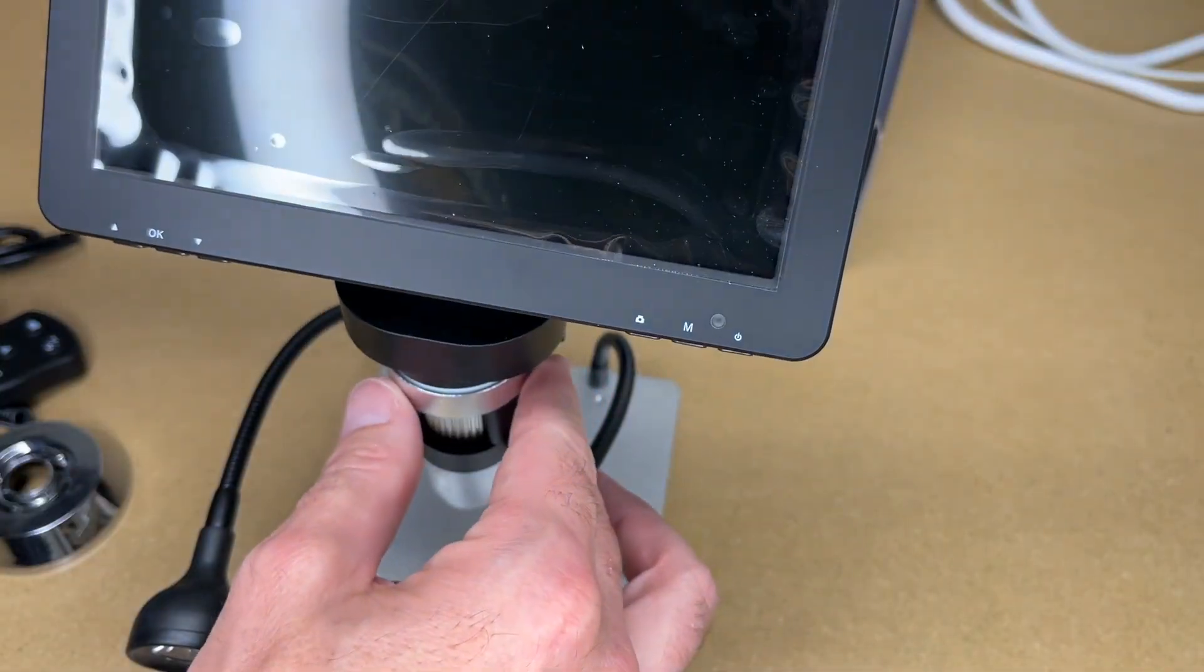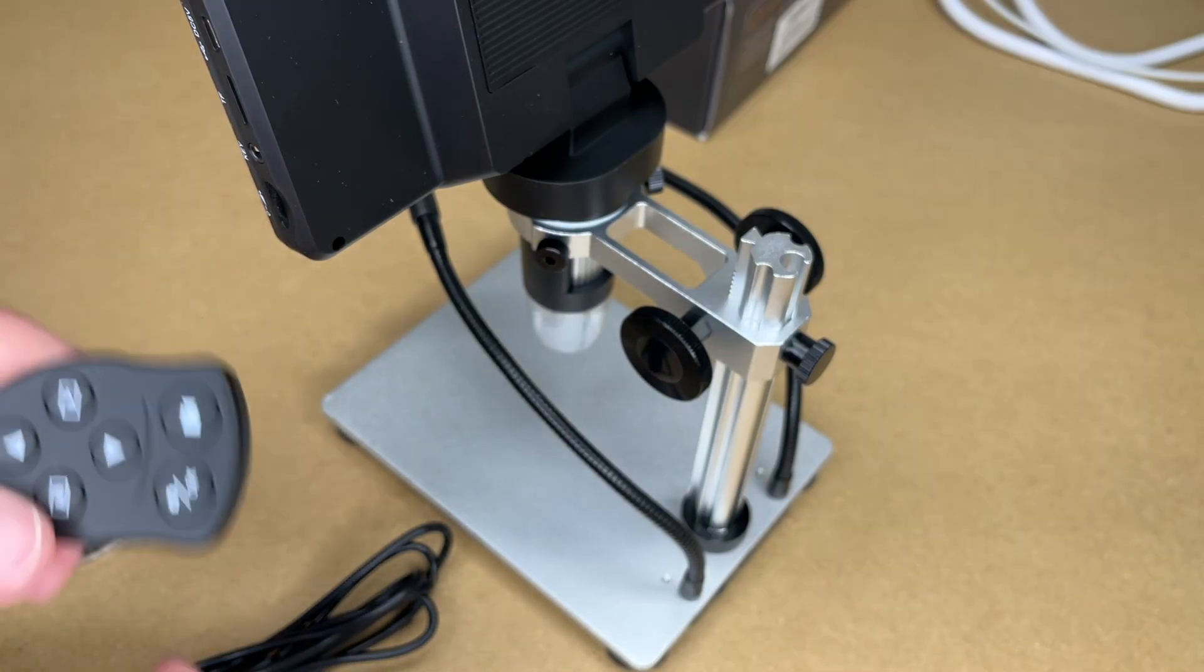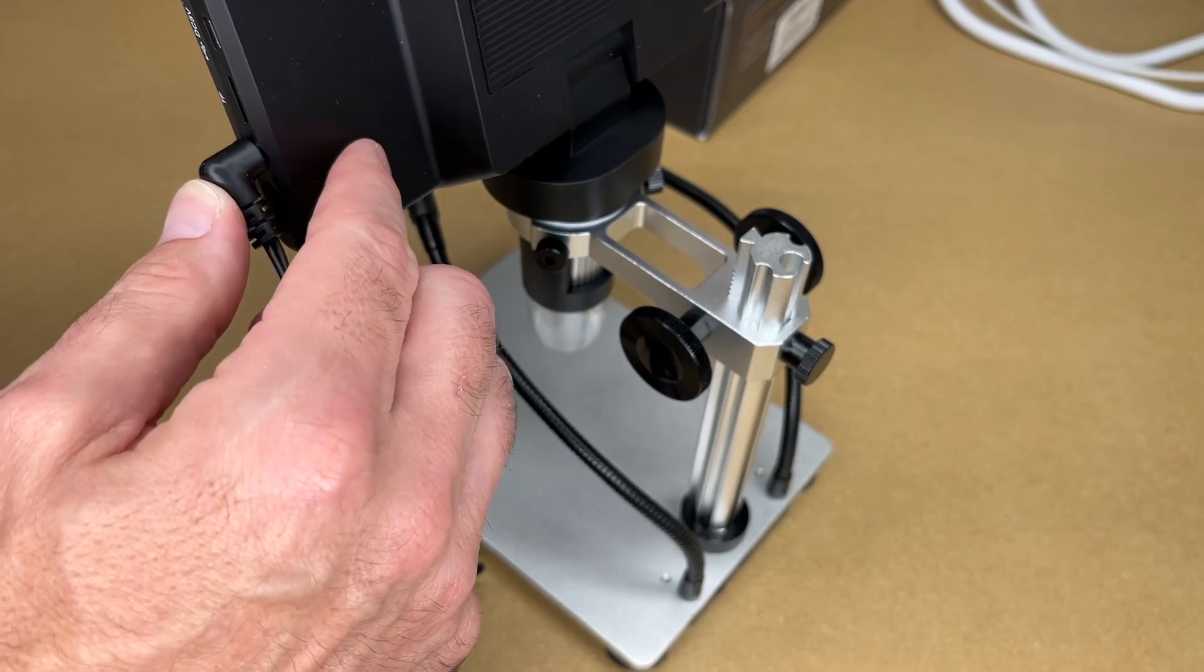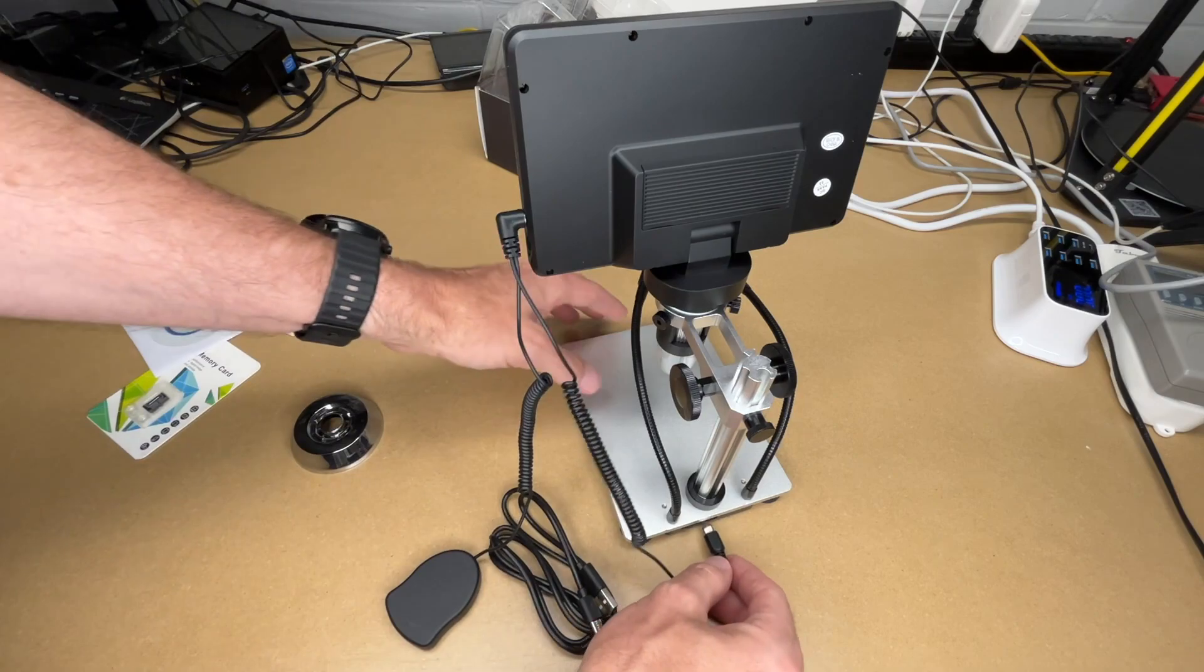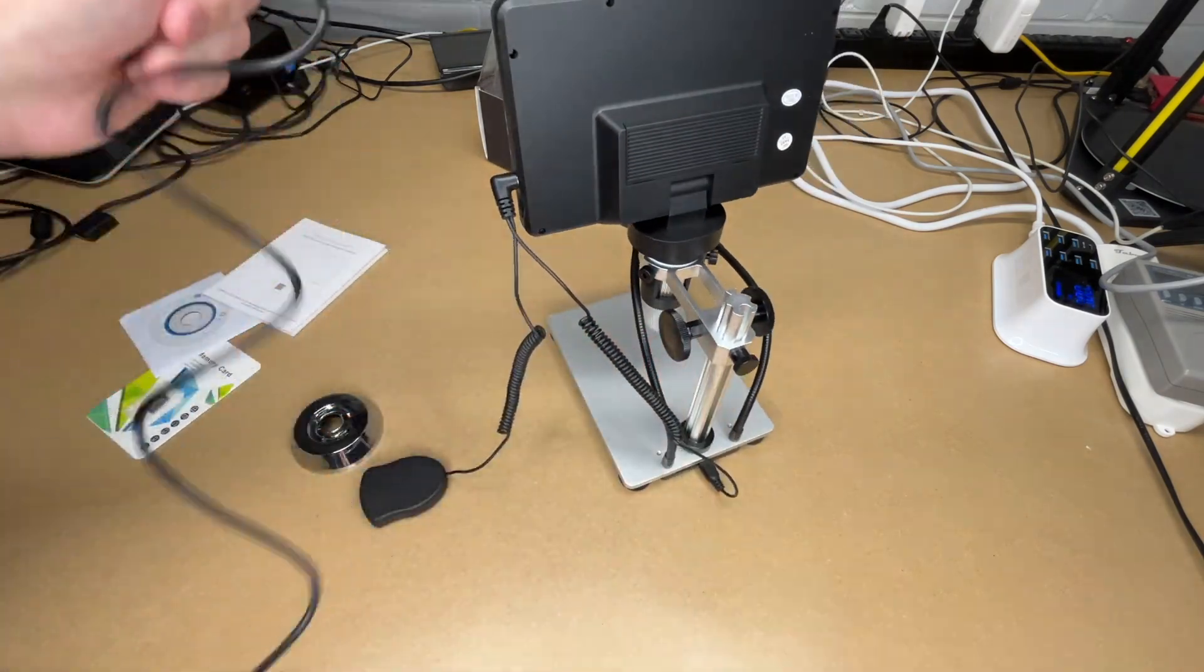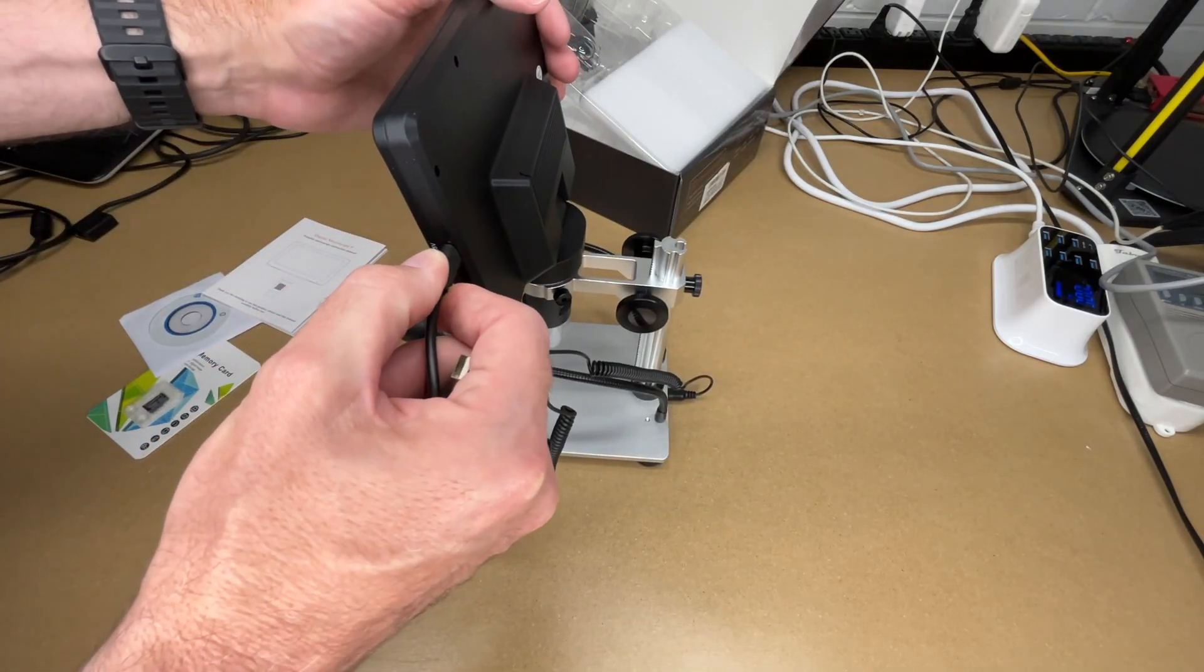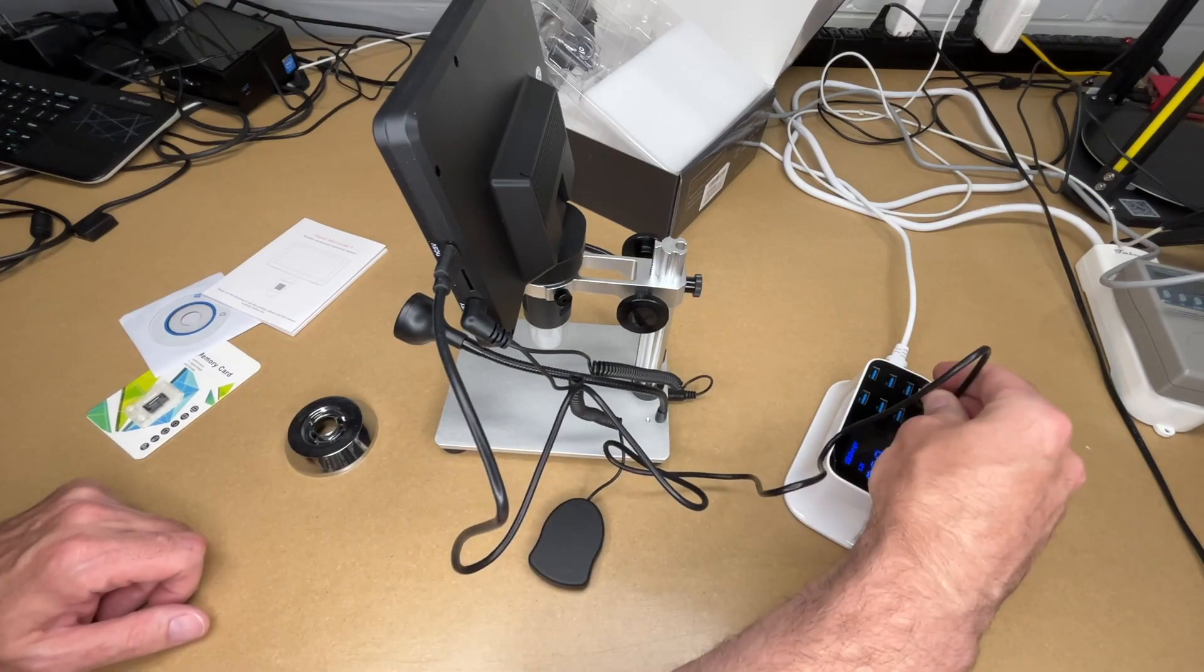So I have the power cords here. You do need to supply your own USB chargers. So I'm going to plug this in here in the monitor. Let me back up just a little bit. There we go. And then we have a cord coming off of it that's going to plug into the base. And then the main USB cord is going to plug in to the monitor here. This will plug into power. I'm just going to use this USB charger. I'll plug that in.